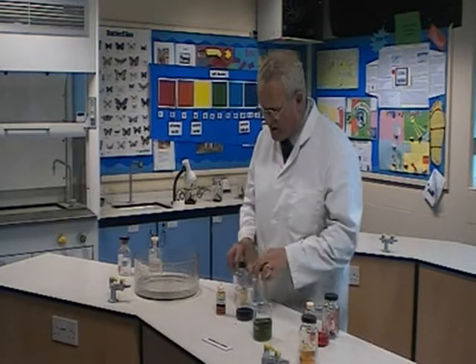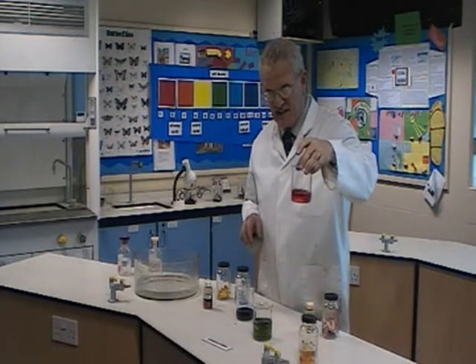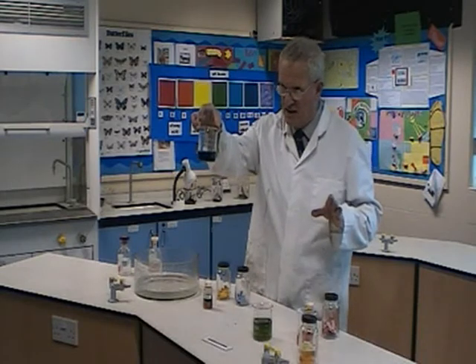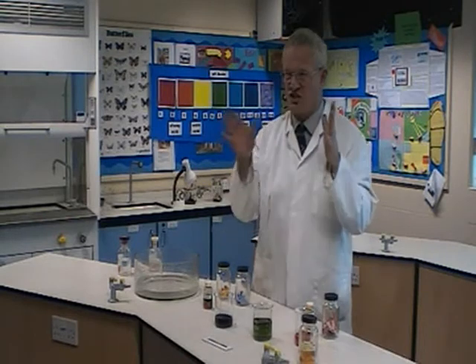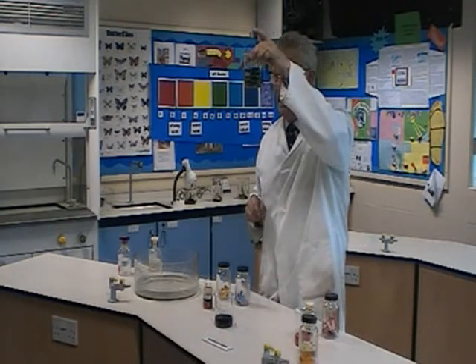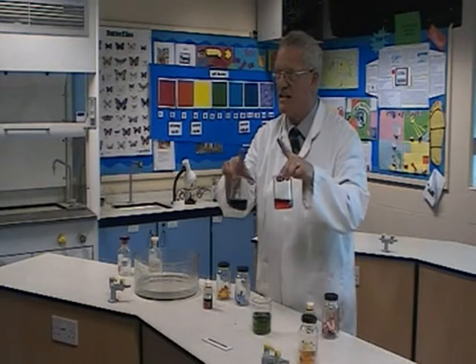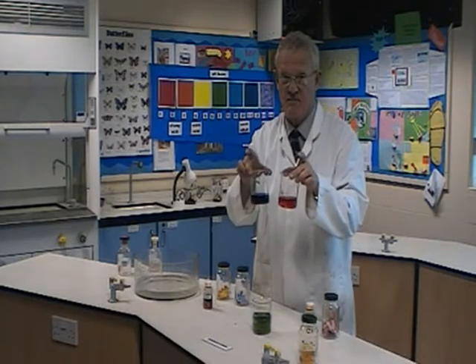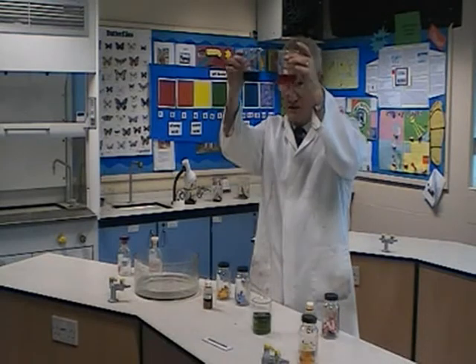If you were to take an equal amount — equal volume — of that acid and an equal volume of the alkali, and put the two together, if they were the same strength — in chemistry we say the same concentration — it should come out green. In other words, they will cancel each other out; they will neutralize each other. Popping the two together neutralizes each one. It probably won't work here because I've got different volumes.